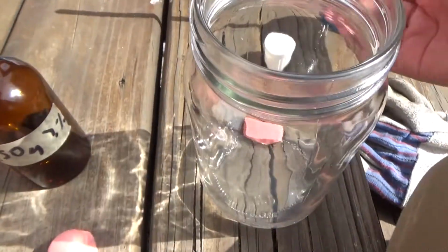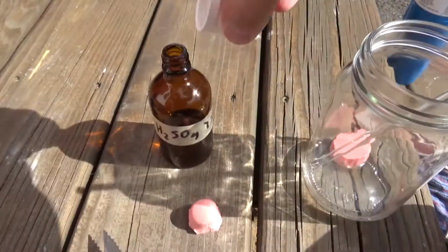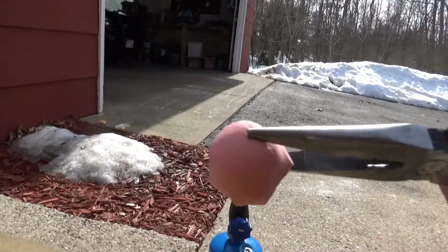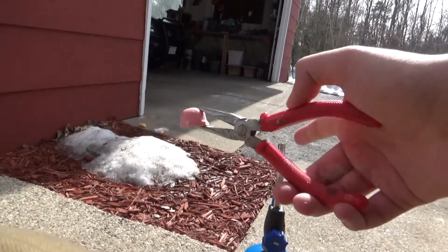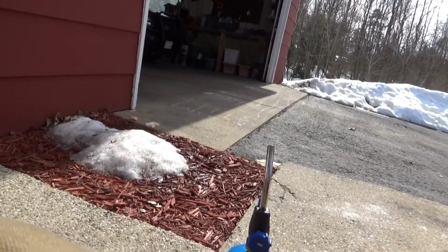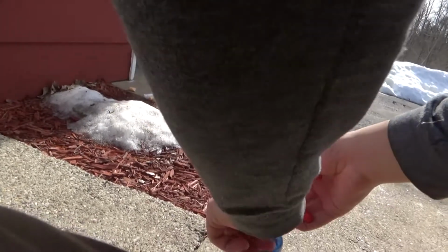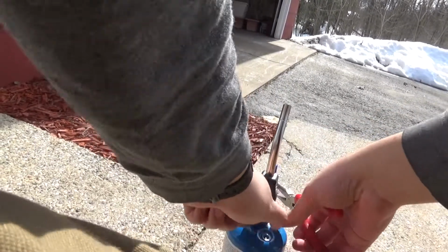So I guess we'll just leave it here and see how that does. Actually, better not set that there. I'm going to recap the acid, and while we're waiting for that, we might as well start the heat test. Okay, here's my piece of Proto Putty in a pair of pliers. I'll turn on my torch and see how well it holds up to heat. So here we go. It might be a bit loud, so I might have to bring down the volume while I edit this video, but the visual should be just fine, hopefully.